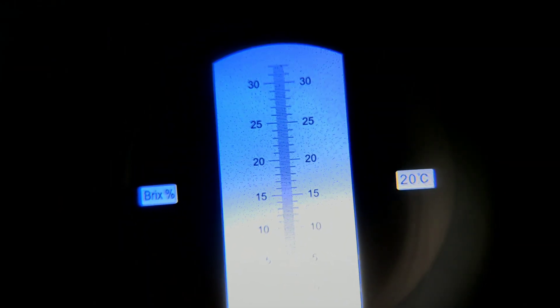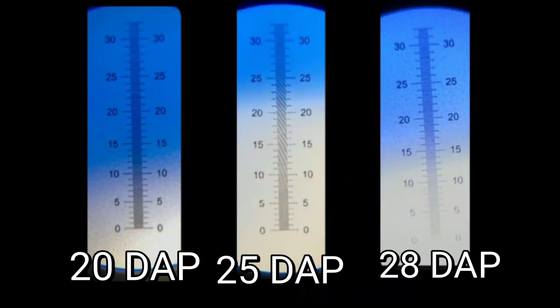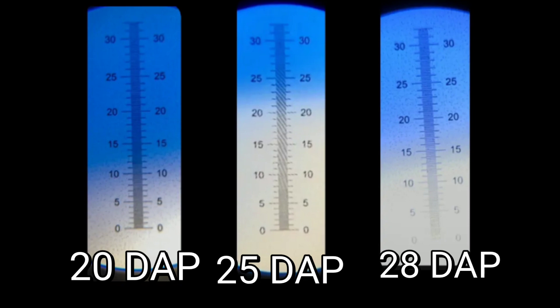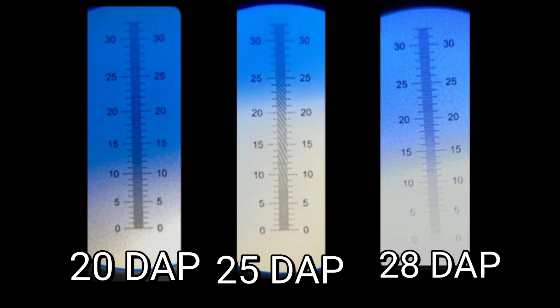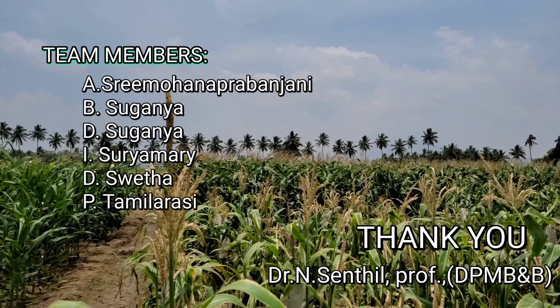The observed Brix value of the 28 days after pollinated cob is 15%. Comparing the Brix values of 20, 25, and 28 days after pollination, the total soluble solids present in the 25-day cob is the highest, at 20%, compared to 10% at 20 days and 15% at 28 days after pollination. Thank you.